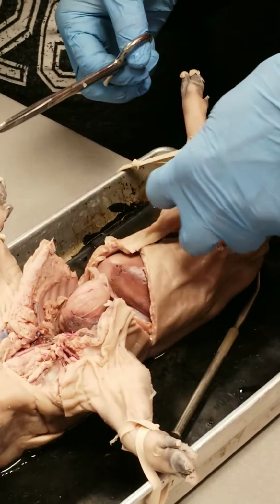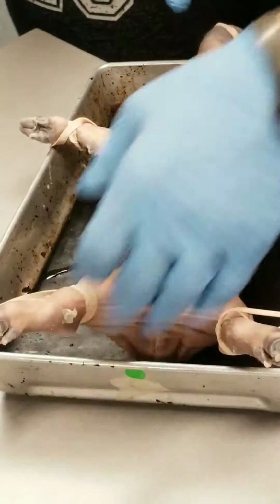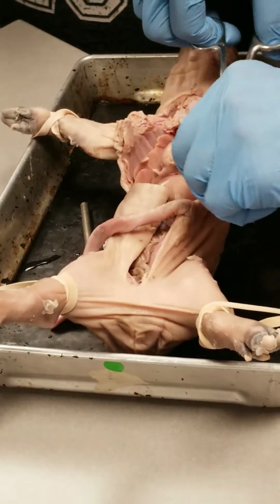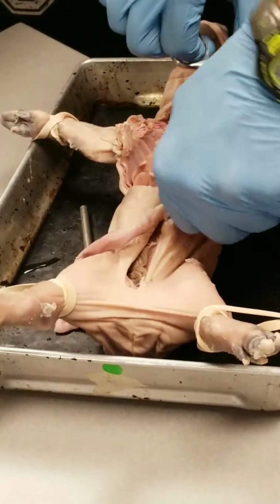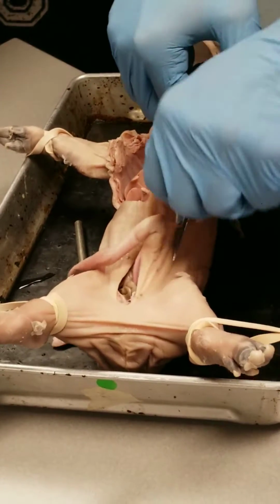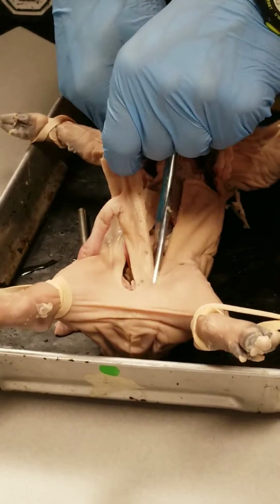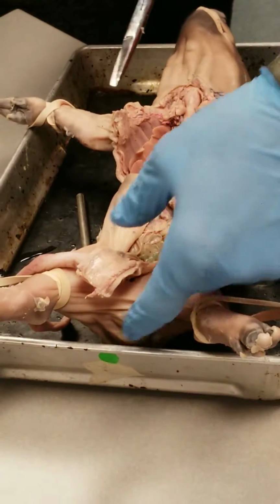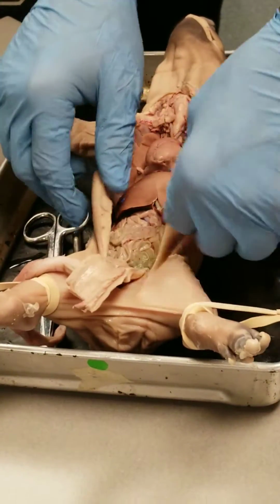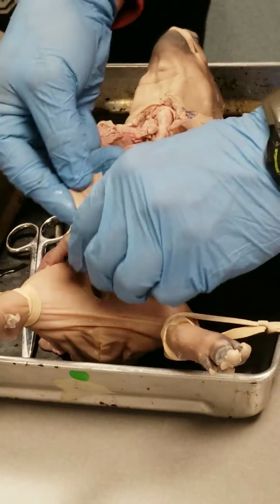The other thing that you might want to do, especially if you have a male pig, is, for male reproduction that we'll do in a couple of weeks, we want to be able to identify the penis. So you cut along the other side of the umbilical cord, like this, back down. Now you can access the abdominopelvic cavity more easily, and for those of you that have a male, you're still going to have a relatively easy time finding the penis.